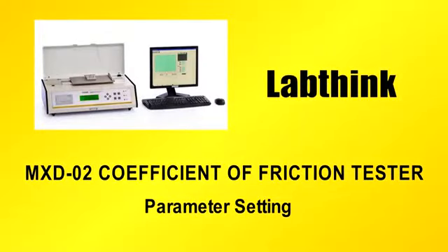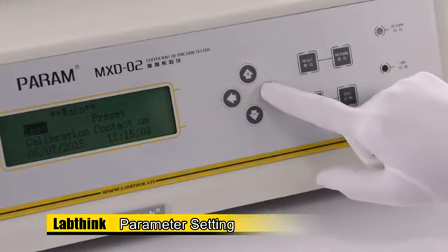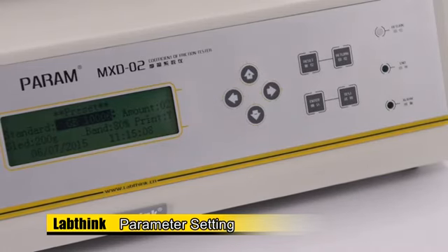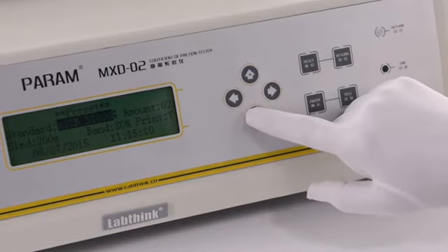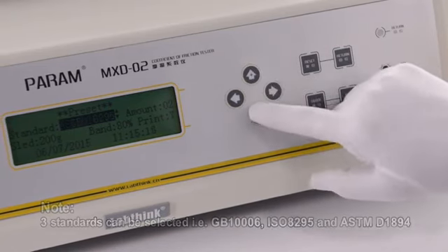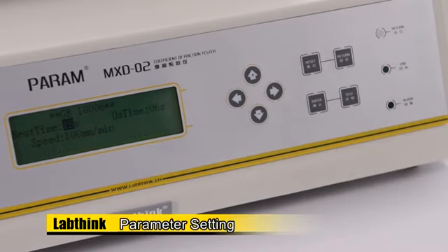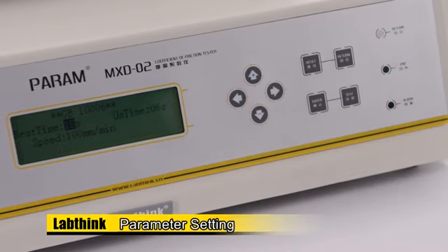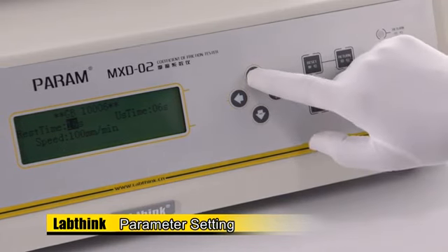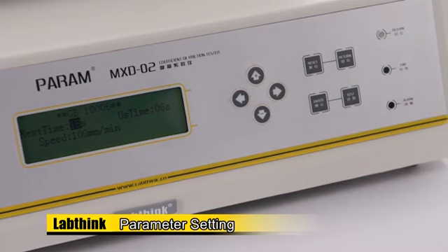Parameter setting. Move the cursor to Preset by pressing the left and right arrow keys. Press Enter to enter the preset interface. Press the left and right arrow keys to move the cursor to Standard and select Standard GB 10006. Press Enter to set parameters. Set rest time as 15 seconds, which is the time when the sled keeps still on the specimen. Press Enter to save the setting.